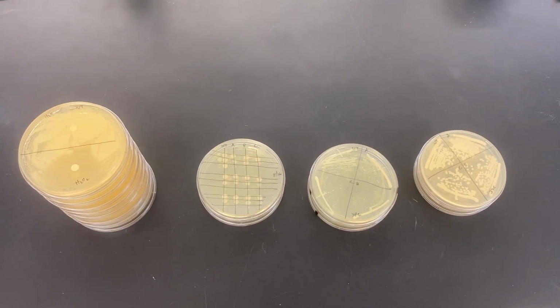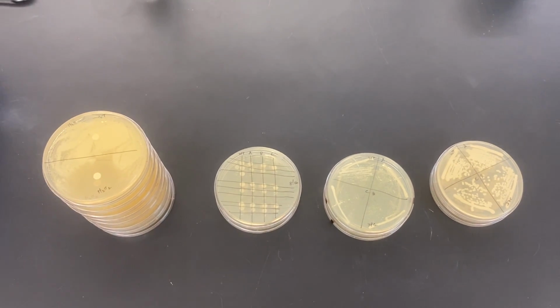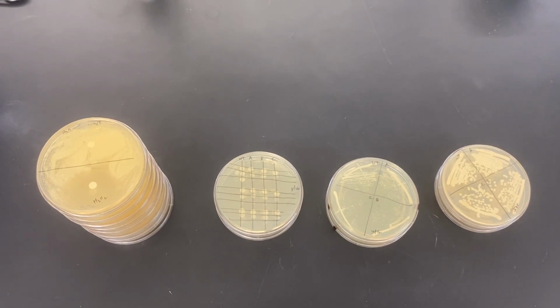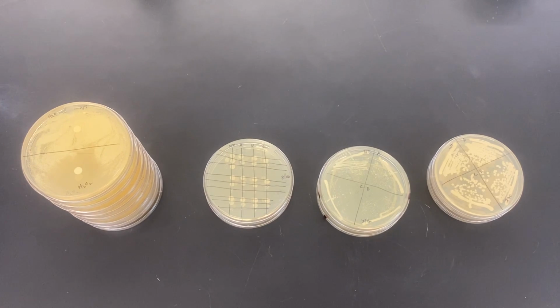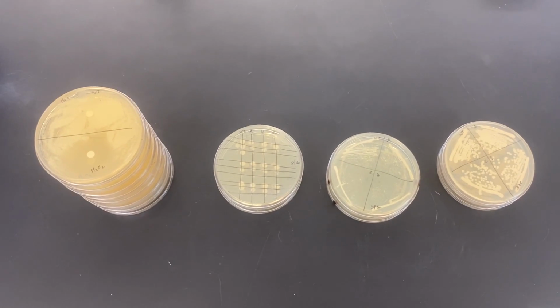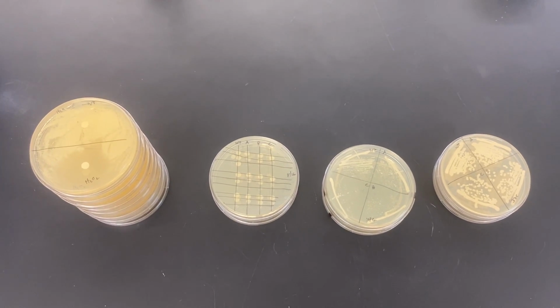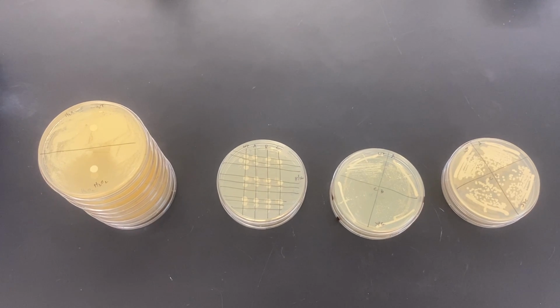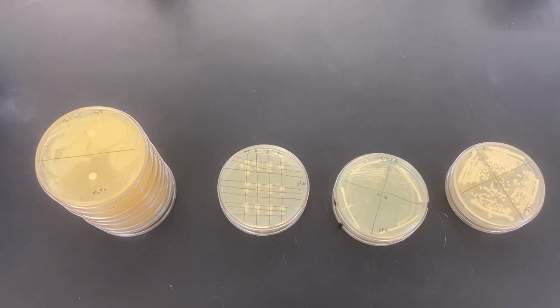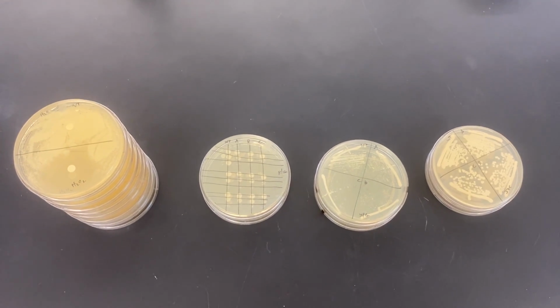So we have now the results of the screening for different kinds of mutations, or another way to look at that is yeast cells that are deficient in some cellular process. So this is sort of like a phenotype for a single-celled organism. The question is, can it grow as well as a wild type, or is it maybe missing something that would make it grow differently?